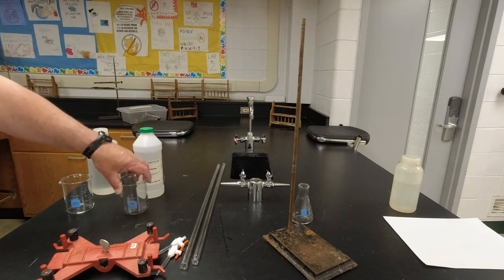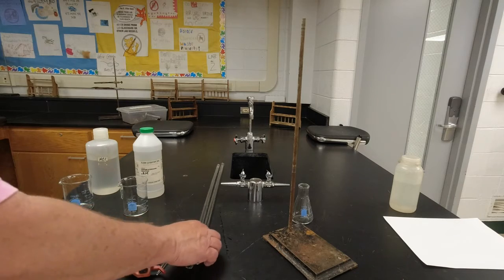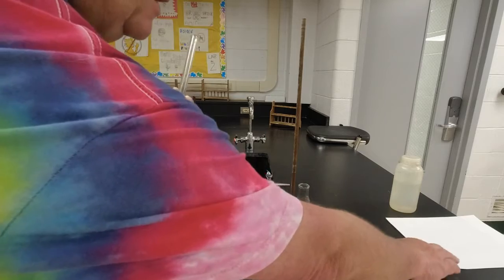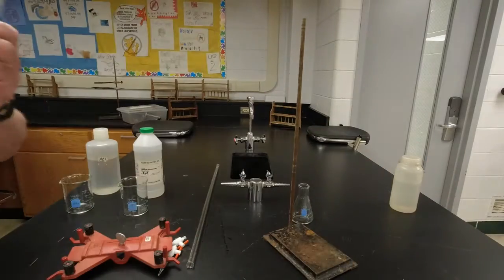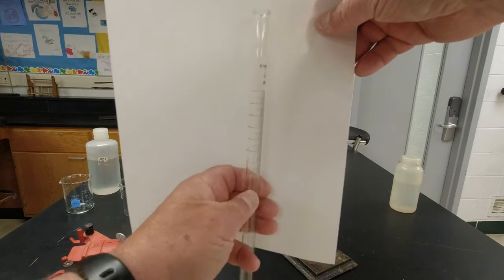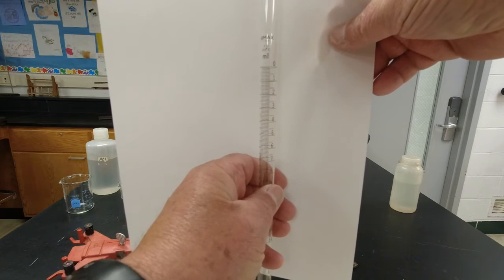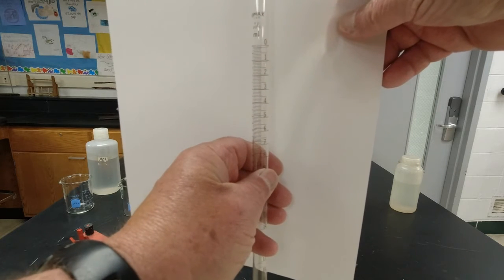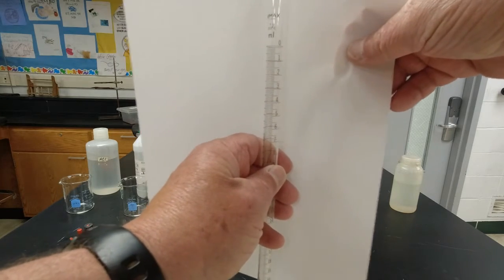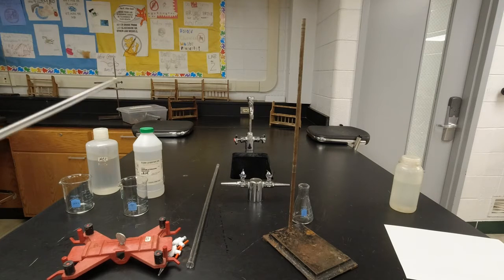And I'm going to use this separate beaker, a different beaker, so I don't contaminate it, to fill up the burettes. Burettes are these very expensive pieces of glassware. It's a glass tube, and if you look closely at it, it's calibrated in milliliters and in tenths of a milliliter, so we should be able to measure to the hundredths of a milliliter if we do it properly. We're going to need one of these burettes for the acid, one for the base. So I have 2 of these glass tubes that are calibrated, and they're pretty expensive.